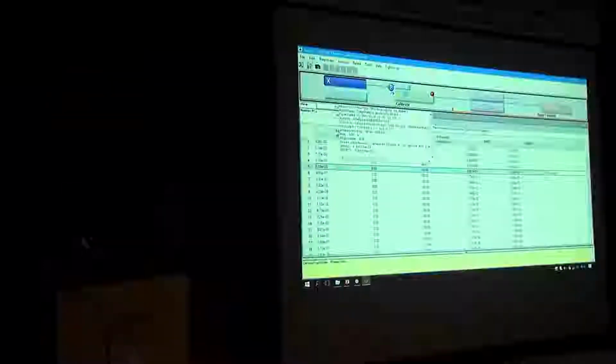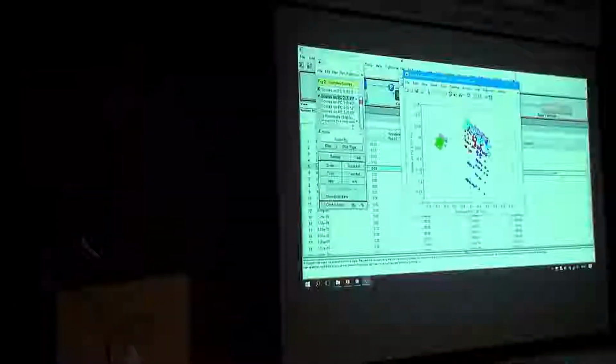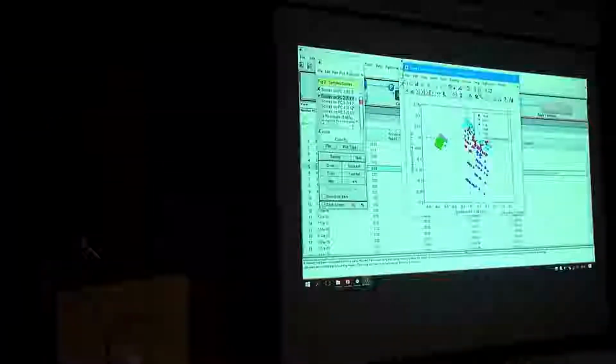Okay, mean centered spectra. Let's do a principal component analysis. And let's look at the score plots. Let's put a label on it.